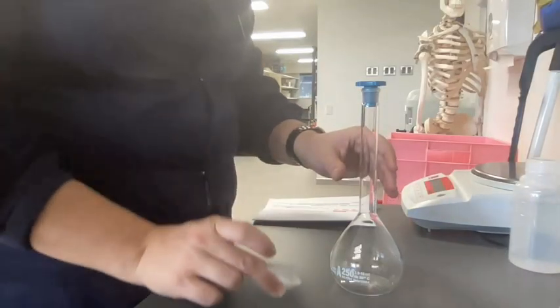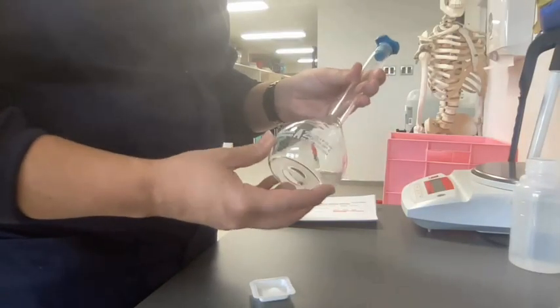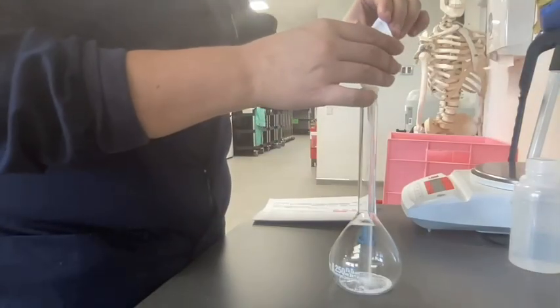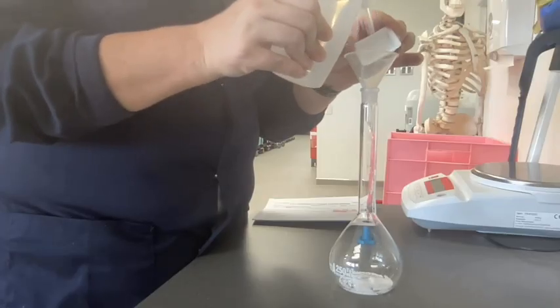And now I'm going to transfer that 2 grams of sodium carbonate into my volumetric flask. This is a 250 ml volumetric flask. Again, it's really important to use the most accurate equipment that we can for this purpose. And I'm going to use the funnel to make sure we don't spill anything. So first thing I'm going to do is just pour as much into it as I can. And then I'm going to get my wash bottle and make sure I get every tiny little bit of the sodium carbonate from the weigh boat into my flask.